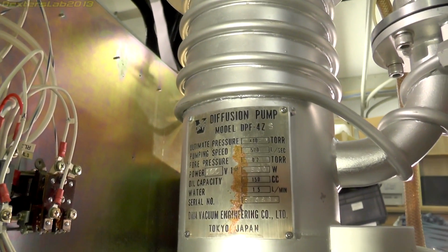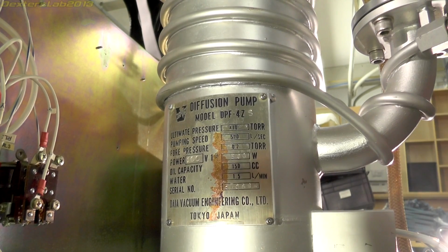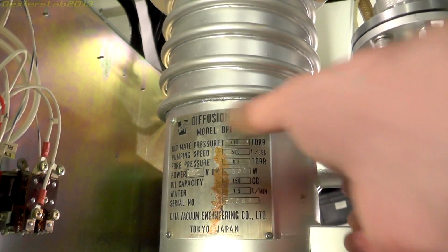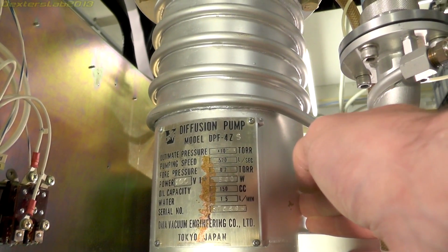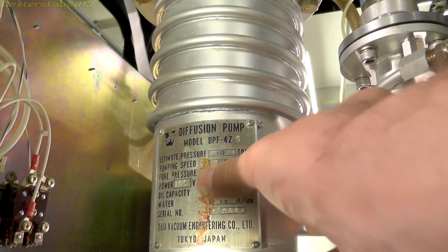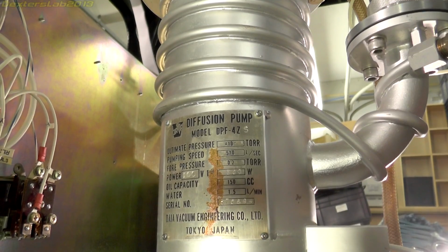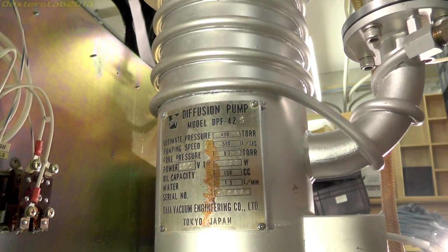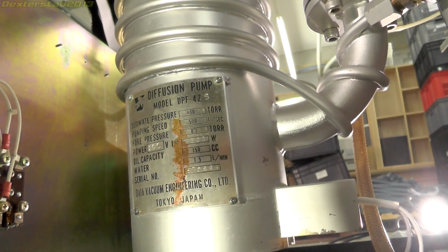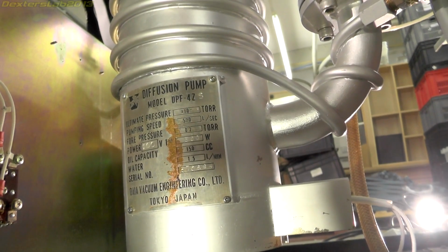So that is a Daia diffusion pump model DPF4Z. Ultimate pressure, 10 to the minus 7 torr, and it's 500 watts. Made in Japan. All the best stuff's made in Japan. In fact, most of the things on here seem to have a made in Japan sticker on them.